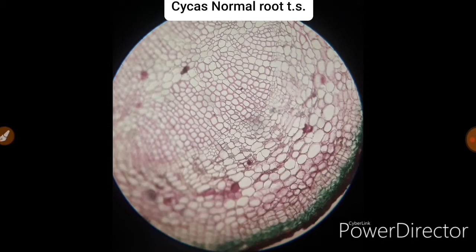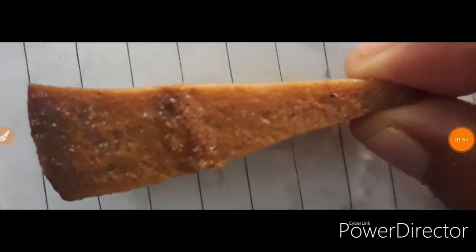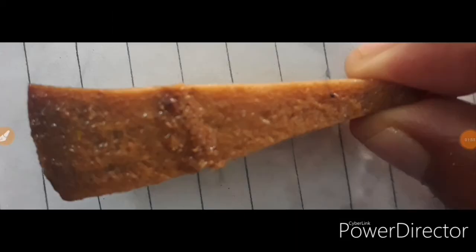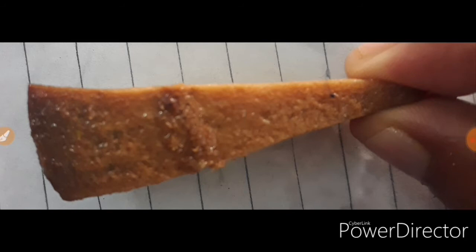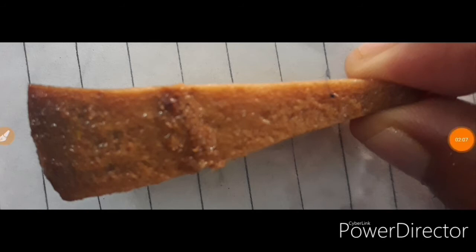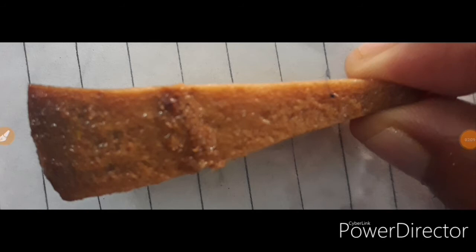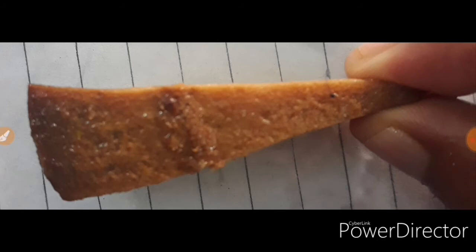This is a portion of Cycas wood. As you can see in this image, this is a portion of Cycas wood. You have to cut lots of sections from the Cycas wood from different angles — you have to cut TLS, you have to cut RLS from this wood.